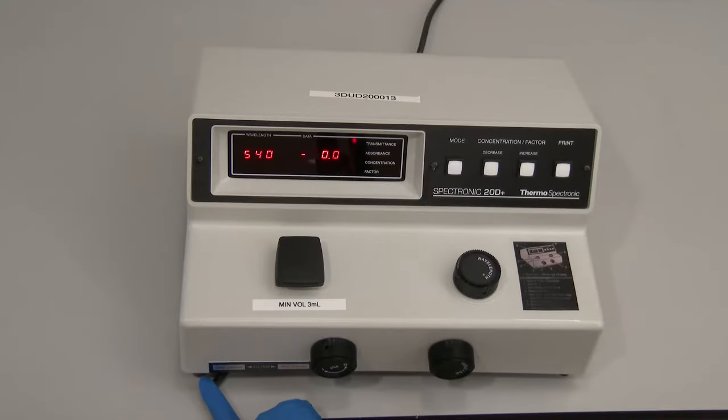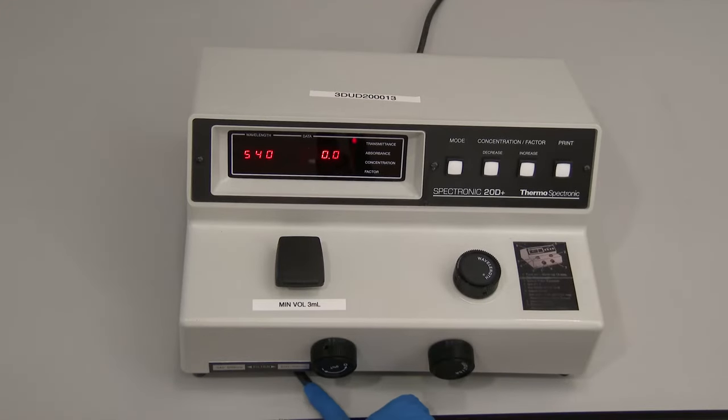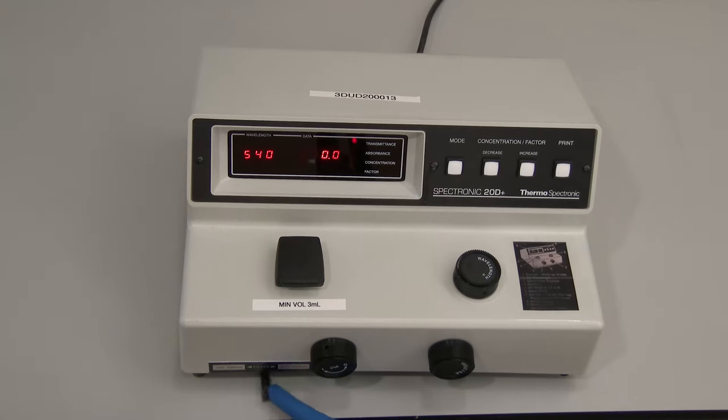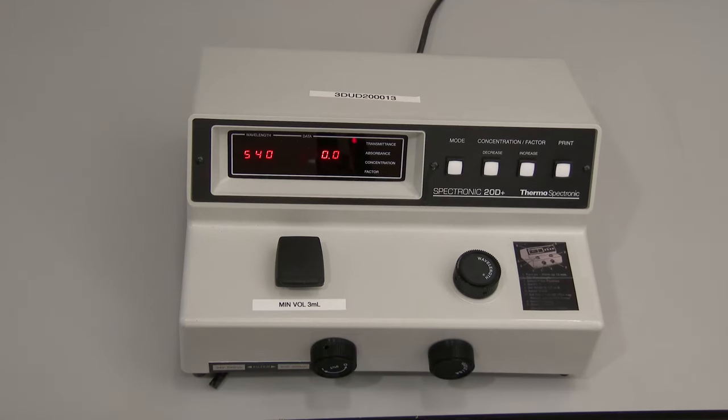Some spectrophotometers may also have a filter lever that must be adjusted to select the appropriate filter based on the wavelength to be used.